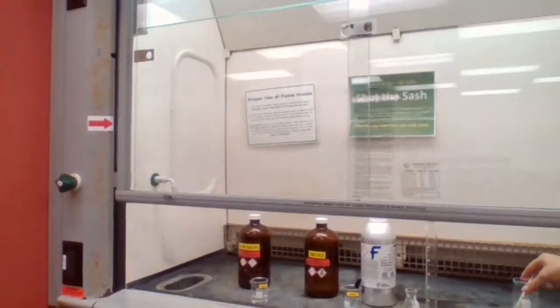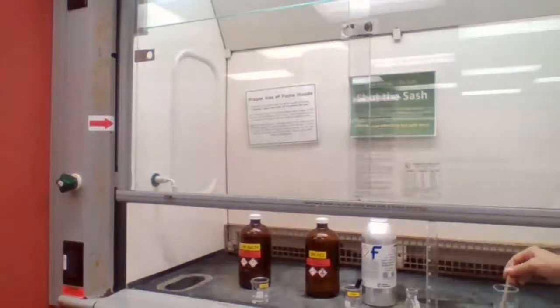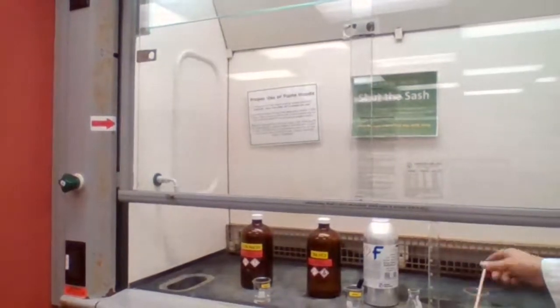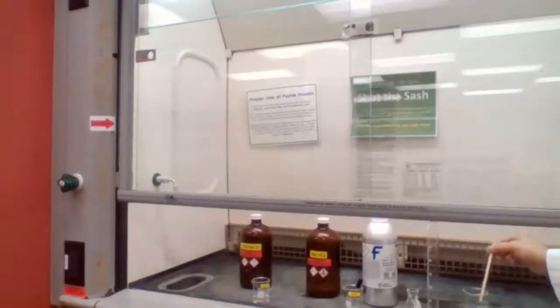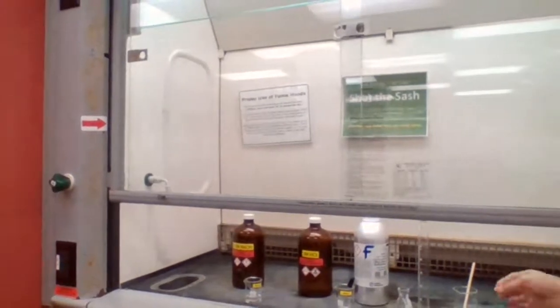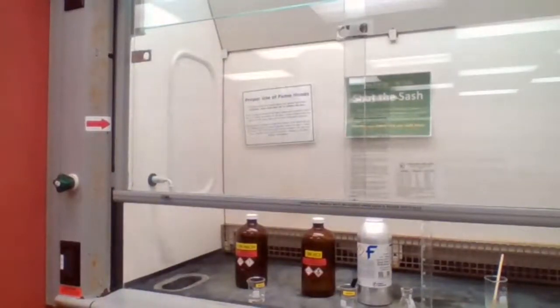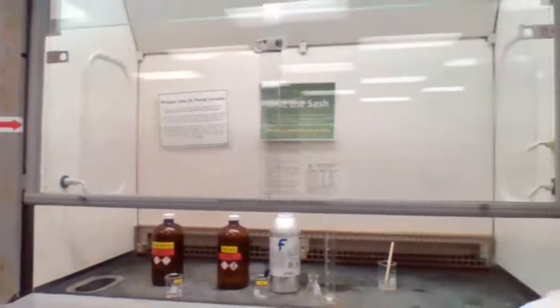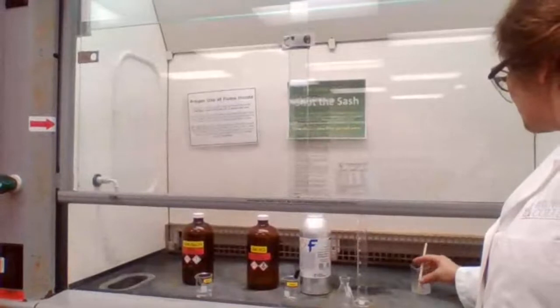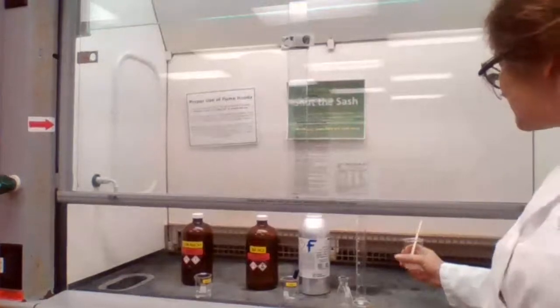I hope that by the time we are done with the other part of the experiment, vacuum filtration, this will be dried out. I added this wood stick, or wood chip, in there. Often it makes the evaporation faster, especially when you are boiling a solvent. A wood stick is very efficient, and I'm trying to use it here to make the evaporation take place faster.